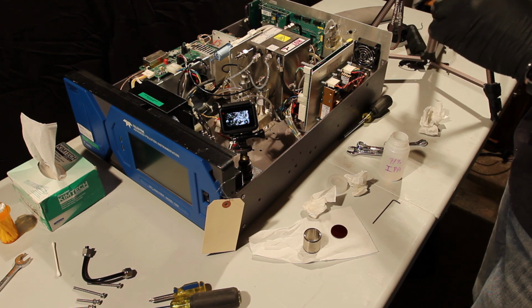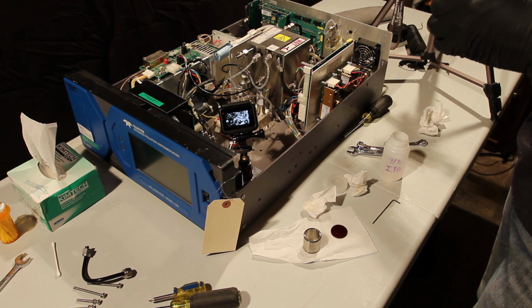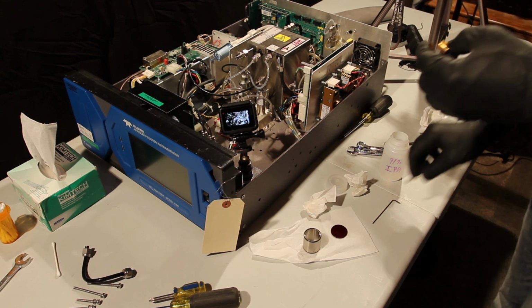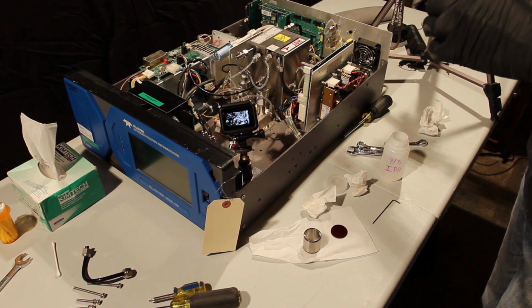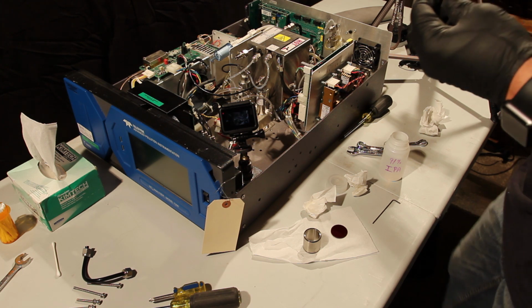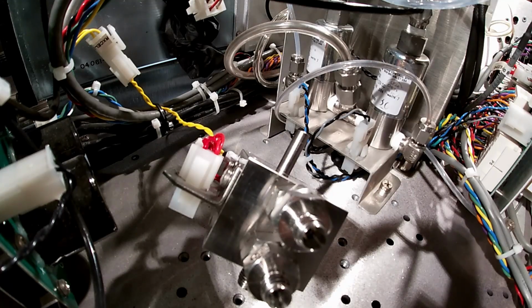If I had an ultrasonic bath, I would put some of these parts into that with just deionized water. When I use deionized water, I'll still typically wipe everything down with methanol afterwards. I feel like it really gets any of that moisture off and cleans it up. But the whole outside of this has just a little bit of buildup on it too, so it's going to help a lot to get the nozzle clean.